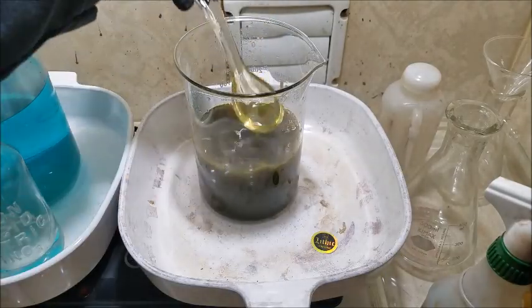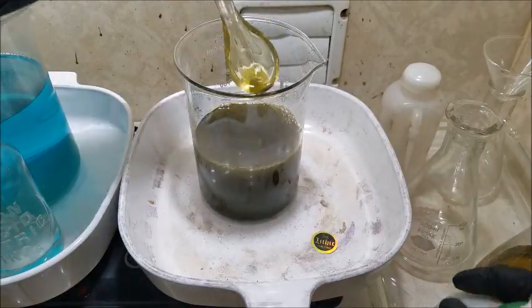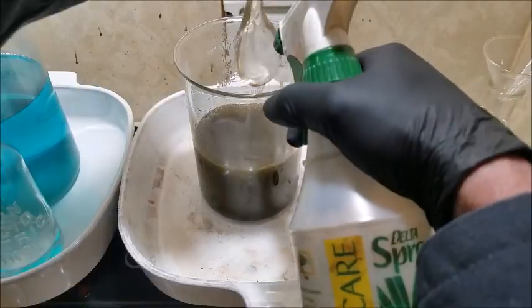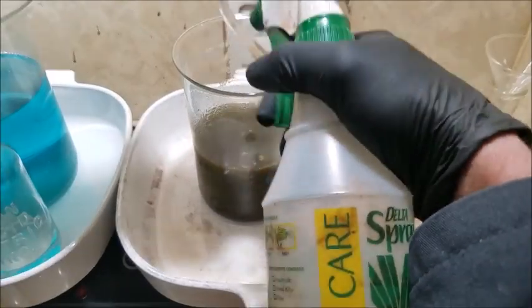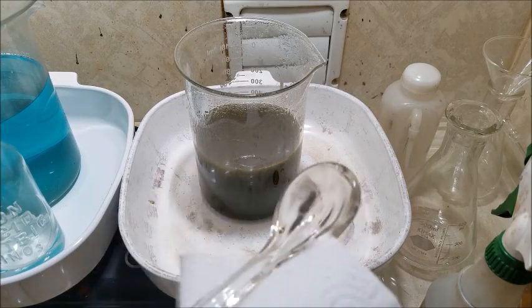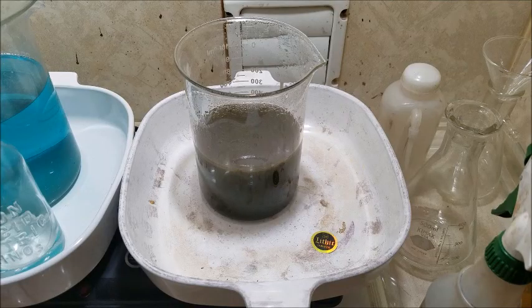Boy, it still has such a yellow color. This is definitely not a normal batch of gold. I don't know if I still have to add more SMB. Gosh, I hope not. I don't want to spend more chemicals on this than necessary. We'll do a stannous chloride test and see if we can get any signs of gold being still in solution. From the color of that dripping out, I would say it is.